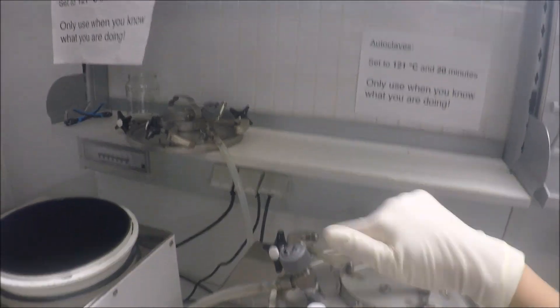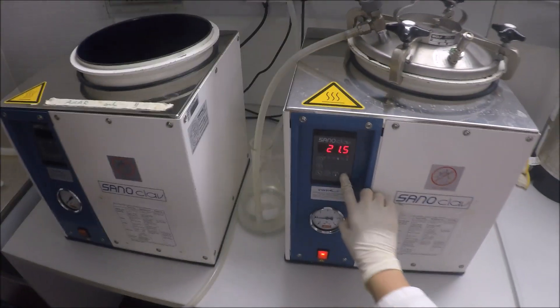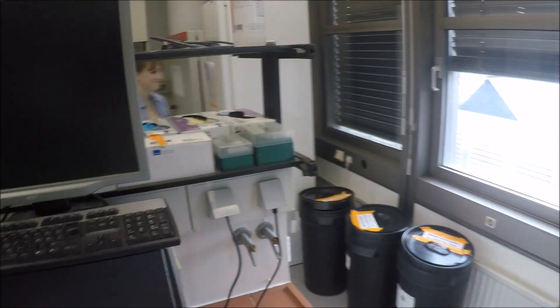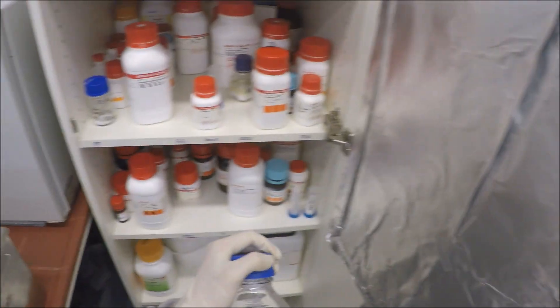We have to close it really well because the pressure and temperature are going to increase inside. So we have to close and seal it really well. Now the artificial seawater is done and I can go on to another project. Say hello to Barbara — thanks a lot for the key!